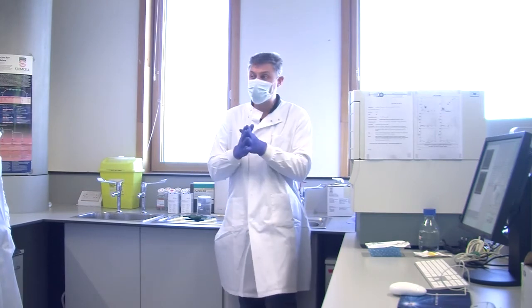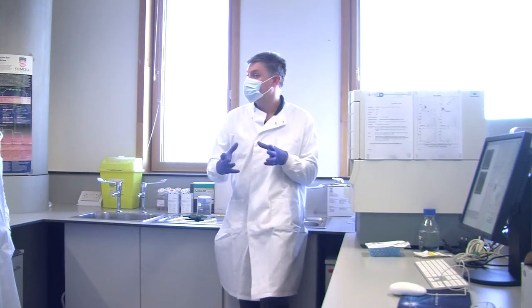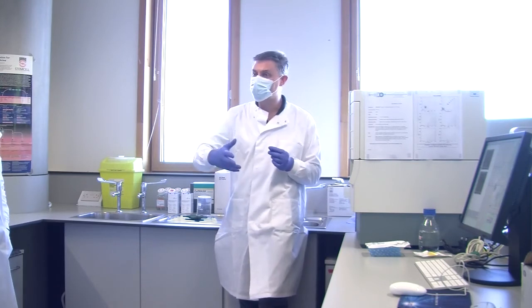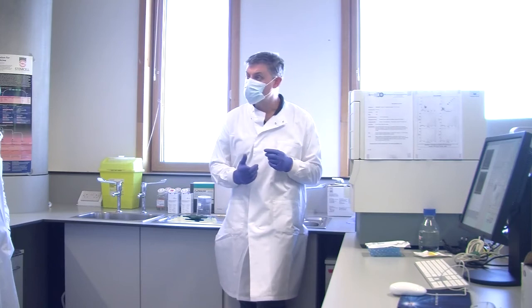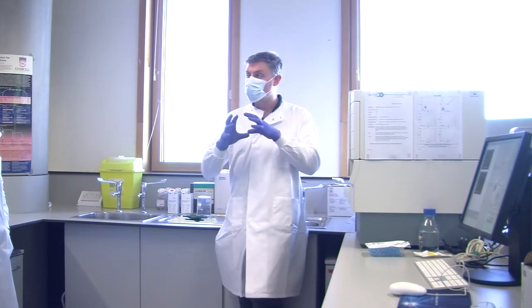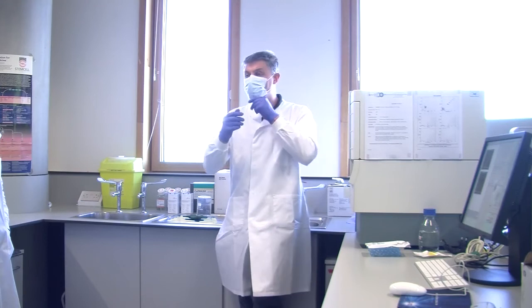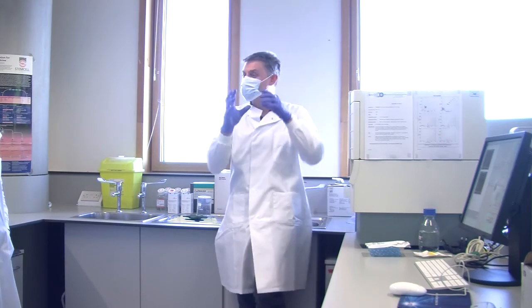But it depends on the cell type. Some cells are really, really sticky, and if they stick to the tube and then come off, you get a lot of carryover. Some cells are non-sticky. It's also possible to block this. One of the problems we had, I can't remember if it was last year or the year before, was that the cells were very clumpy. We'd resuspend them, and you would hold it up to the light and see lumps floating around, visible to the eye.